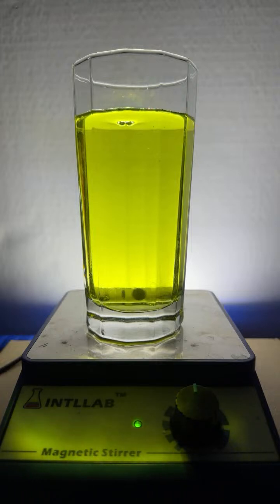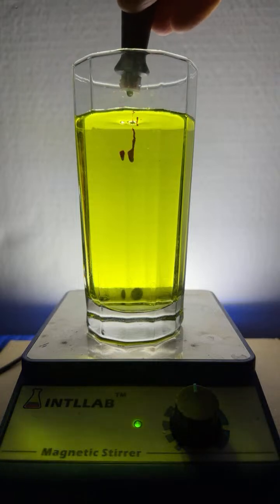I wonder what would happen if, let's see if I can get it to the green. I add a drop of base. Yeah, it's just really nice. I'm gonna add a drop of the happy little chartreuse. I'm gonna add a drop of red to this. So we've got 2 different indicators.